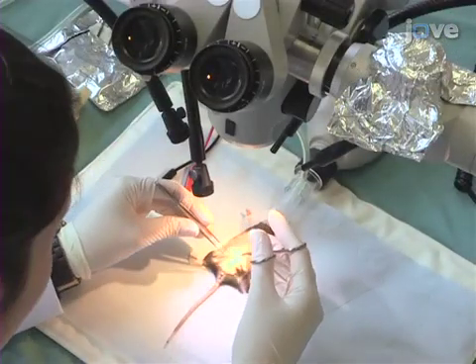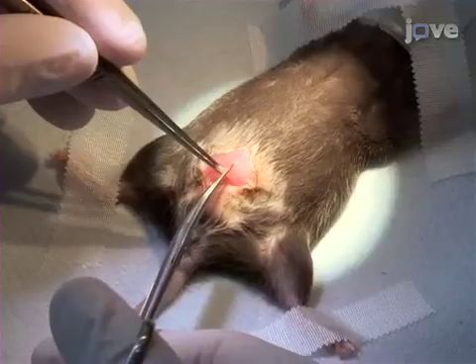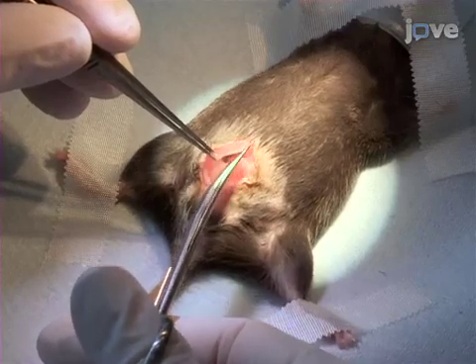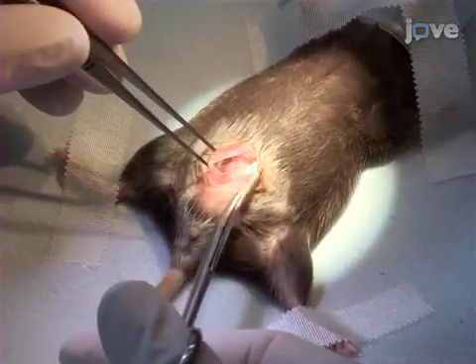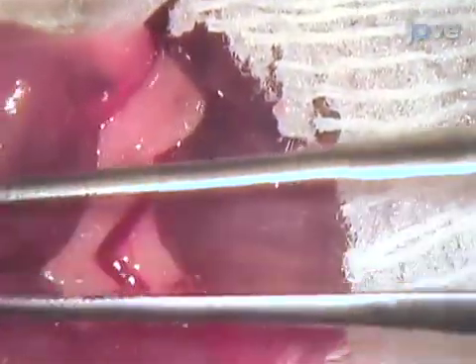Make a longitudinal incision about 1–1.5 cm long on the abdominal skin, then cut the peritoneum. Place cotton gauze around the incision and rinse the gauze with PBS. Expose one uterine horn by pulling it out carefully with blunt forceps. Avoid pulling the mesometrium or the uterus tightly, since high pressure inside the uterus will increase the chances of embryo fluid loss upon injection, resulting in abortion.